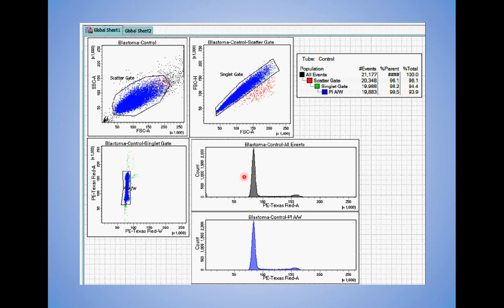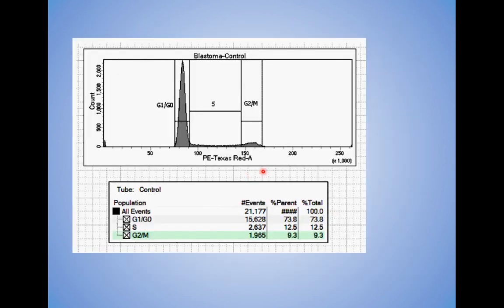But the problem, and where cores have a problem, is when we see users doing something like this. This may have been fine 30 years ago, but it is no longer accepted. It hasn't been accepted for quite some time. We strongly do not recommend this.